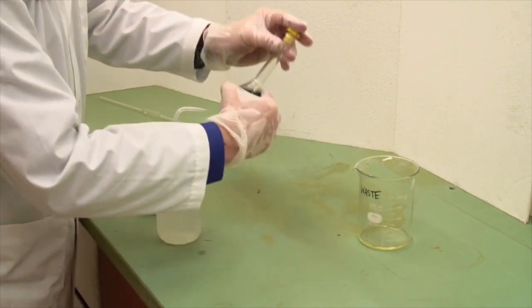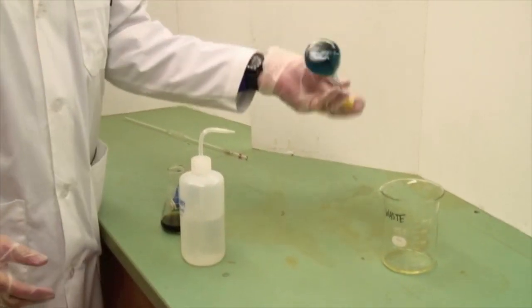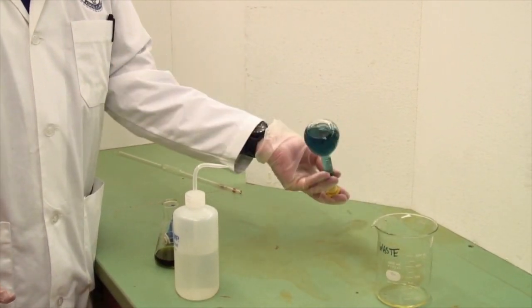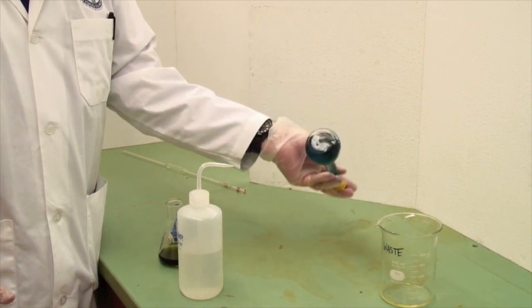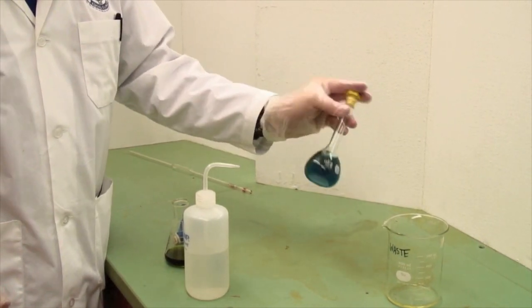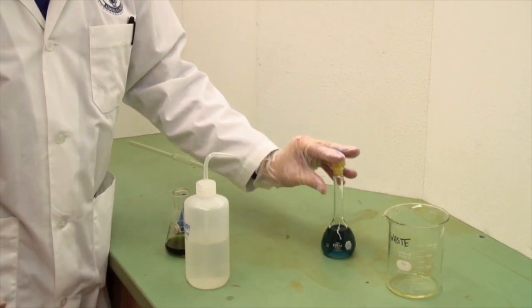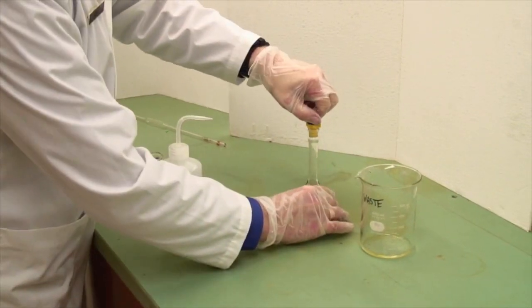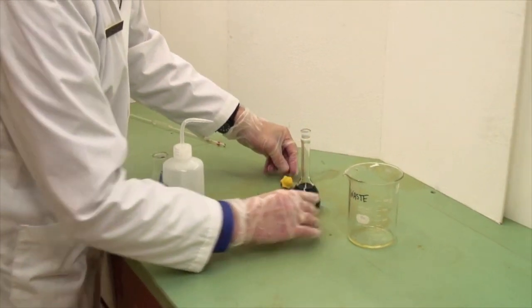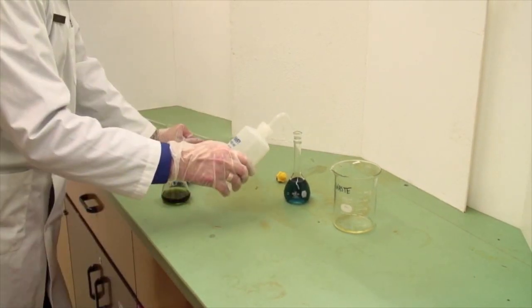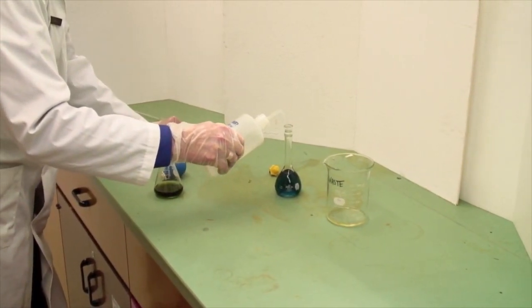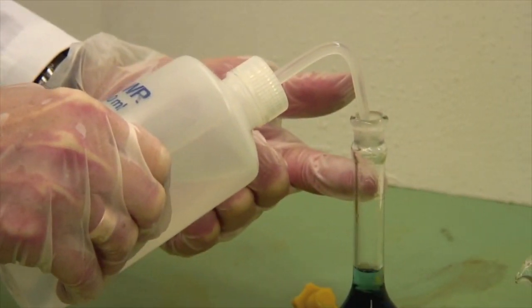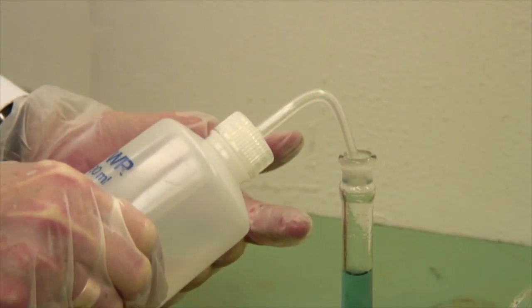Now at this point, take the container and put the cap on. Notice that I'm holding the cap on with my fingers, and invert several times. Let the bubble do the work. You're not playing the maracas here. Just allow the bubble to stir it so that you've now got a uniform solution. Take the cap off, and add water until you're almost at the calibration line. The calibration line is actually where my finger is, so we'll get it fairly close fairly quickly.